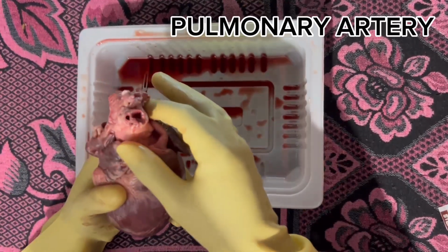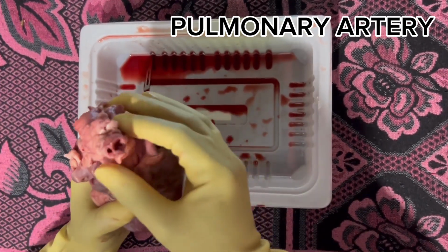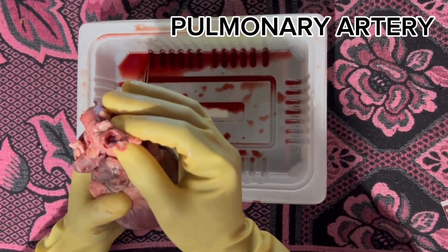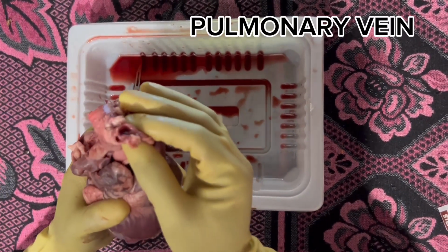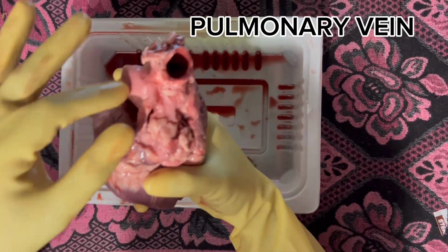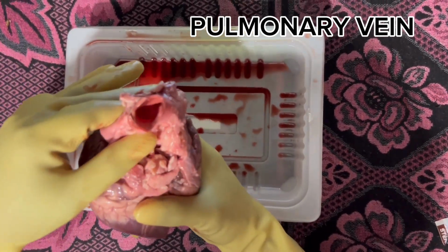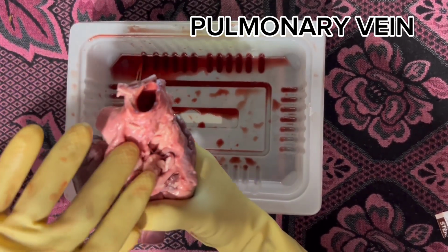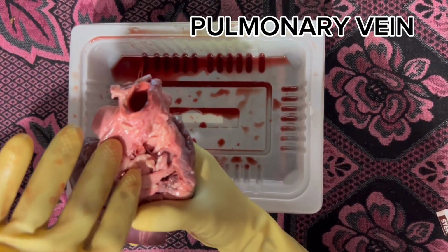Next is the pulmonary artery. It is near the aorta. The function of the pulmonary artery is to carry blood from your heart to your lungs. While at the back side, you can see the pulmonary vein. This is the pulmonary vein. The pulmonary veins are blood vessels that carry oxygen-rich blood from your lungs to your heart.